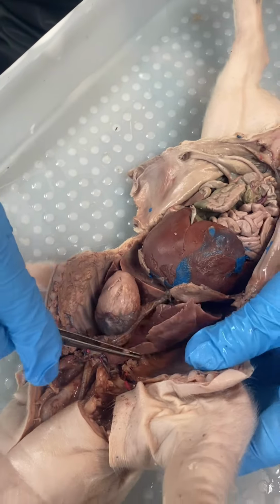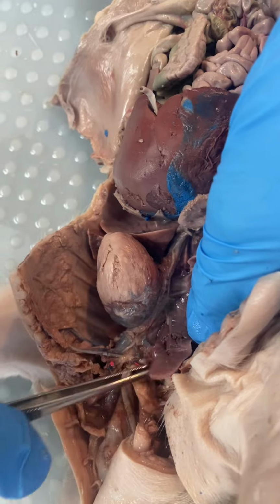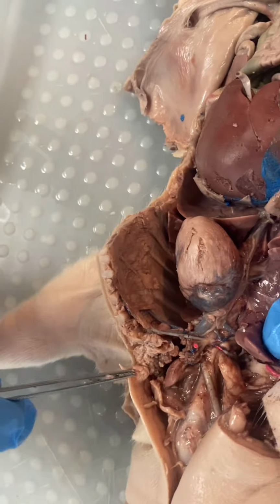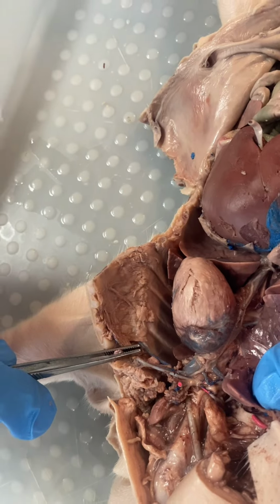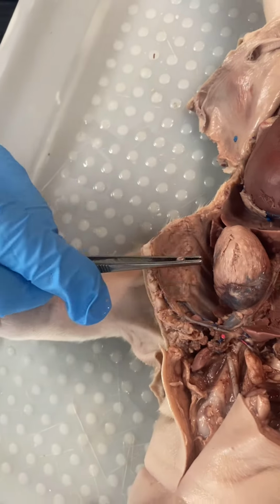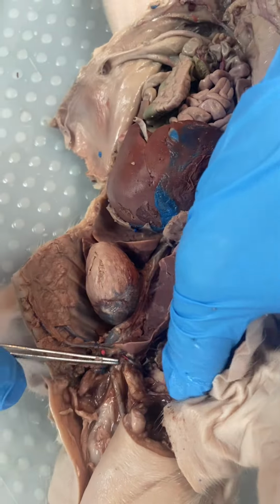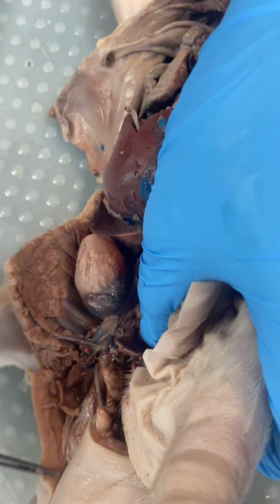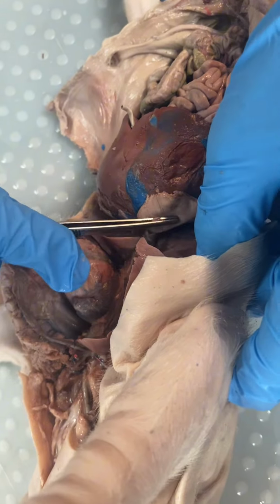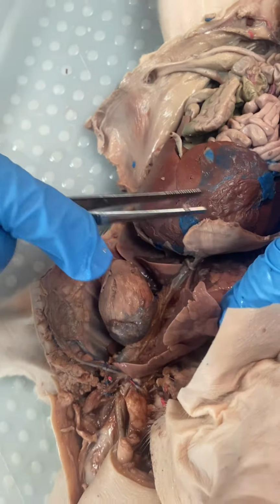These are the lungs. This is the bronchi right here, connecting the lung to the trachea. It's a little tube there. And this is the larynx right here. And the trachea is this whole tube coming down. And the diaphragm is on top of that. We cut some of our diaphragm, but this is it right here.